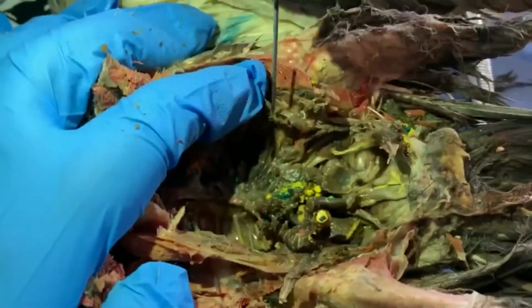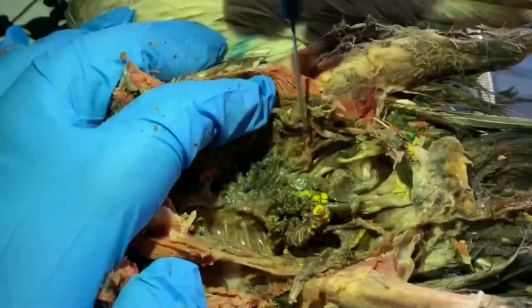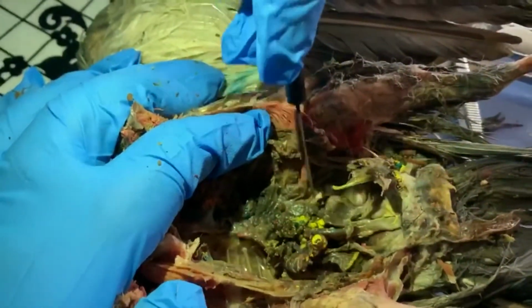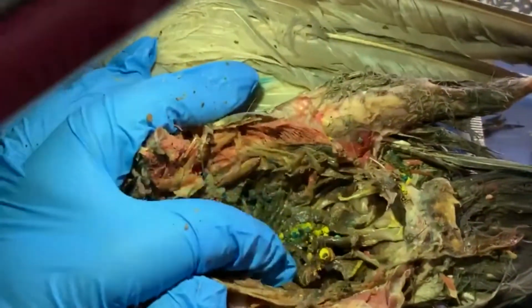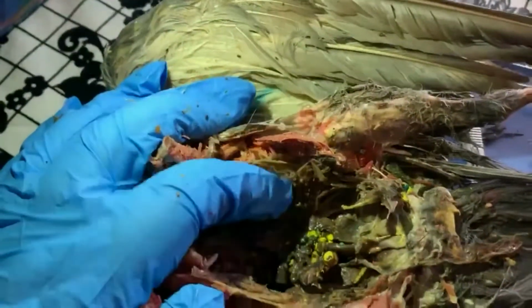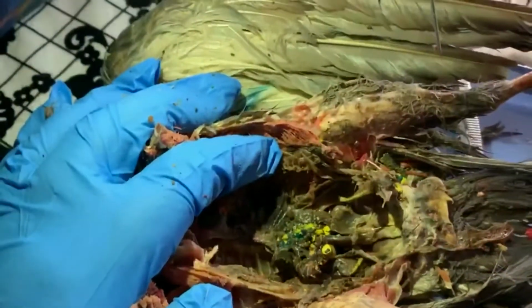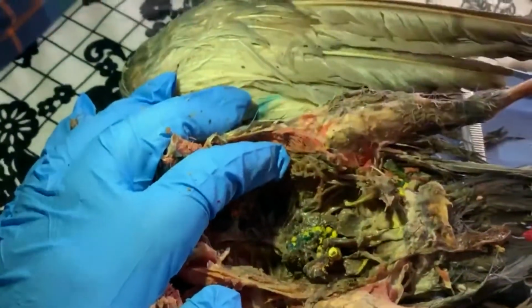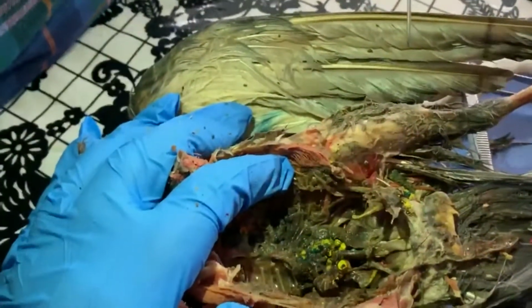All right, looking behind all of our digestive organs, we've got our kidneys located on either side of the spine. Then we have this berry-like structure that represents the ovaries. If this were a male pigeon, we would have two bean-like structures that were the testes. But instead, on the left side of this bird, we have this ovary, and each of these little protrusions represents an egg that could develop. Most females will lay only 3 or 4 eggs during a given reproductive cycle.